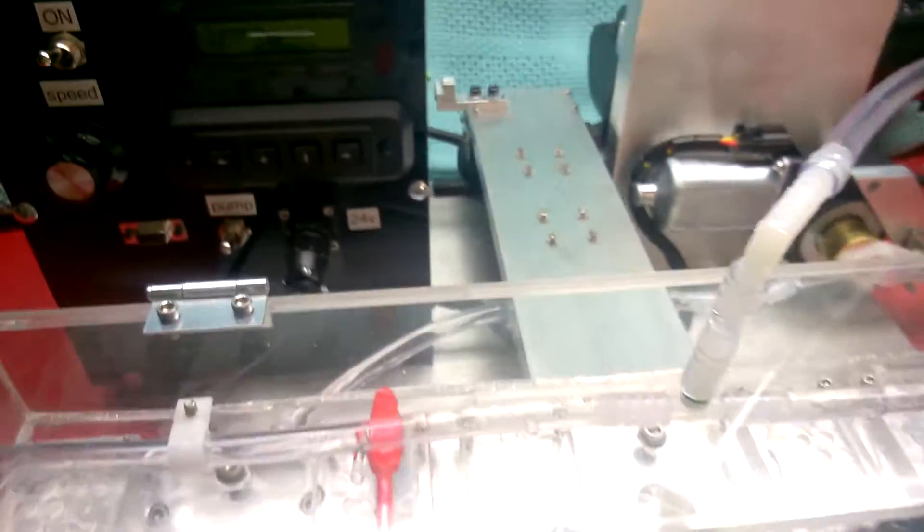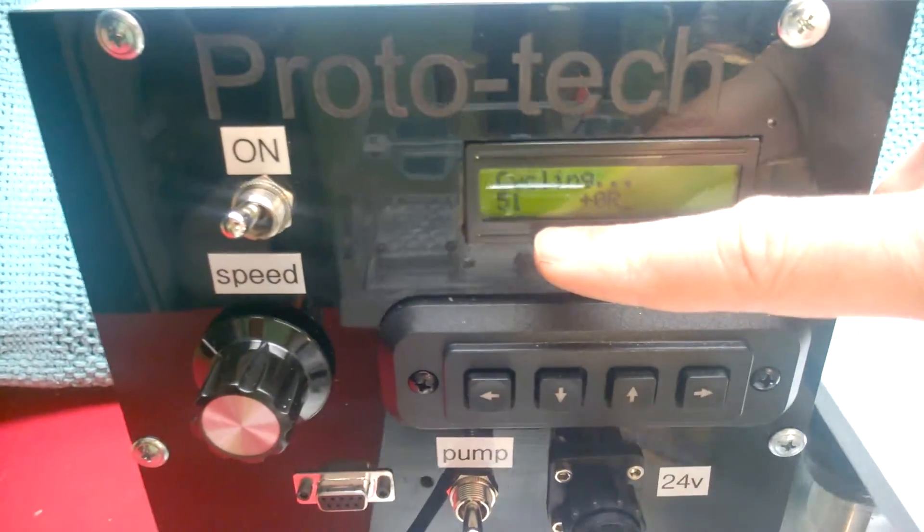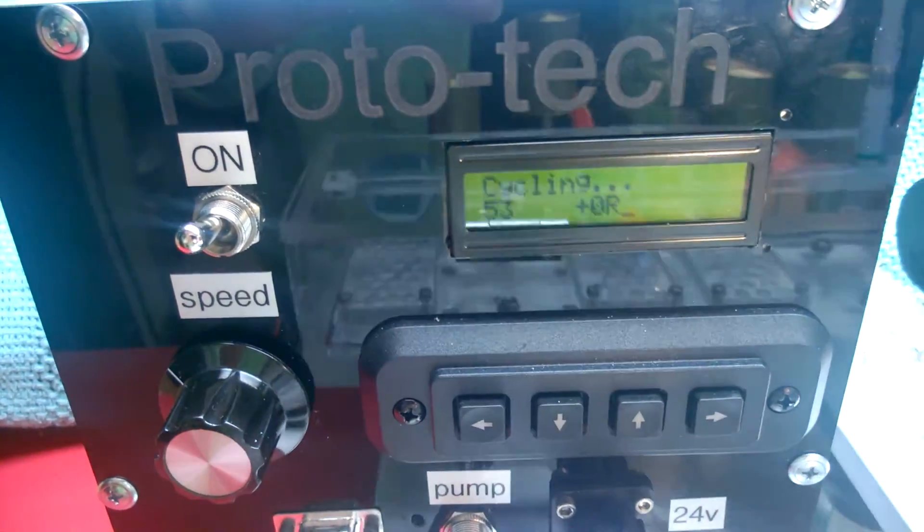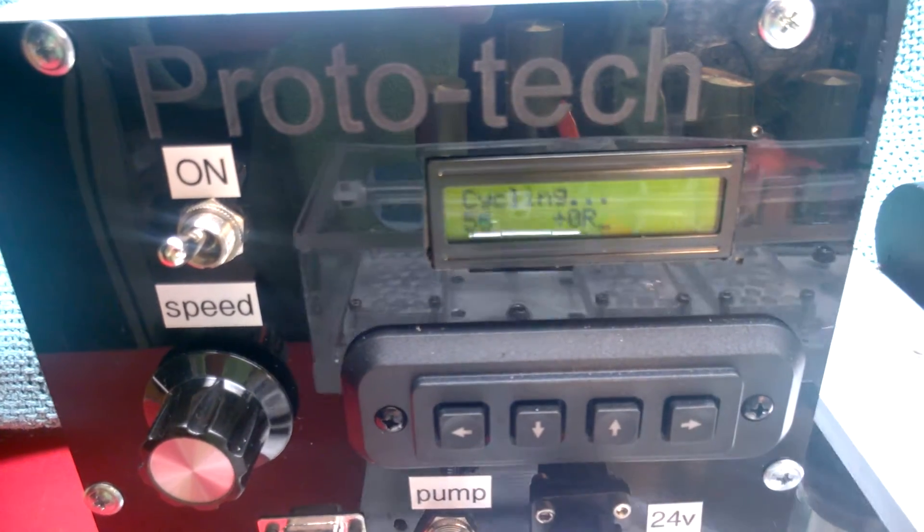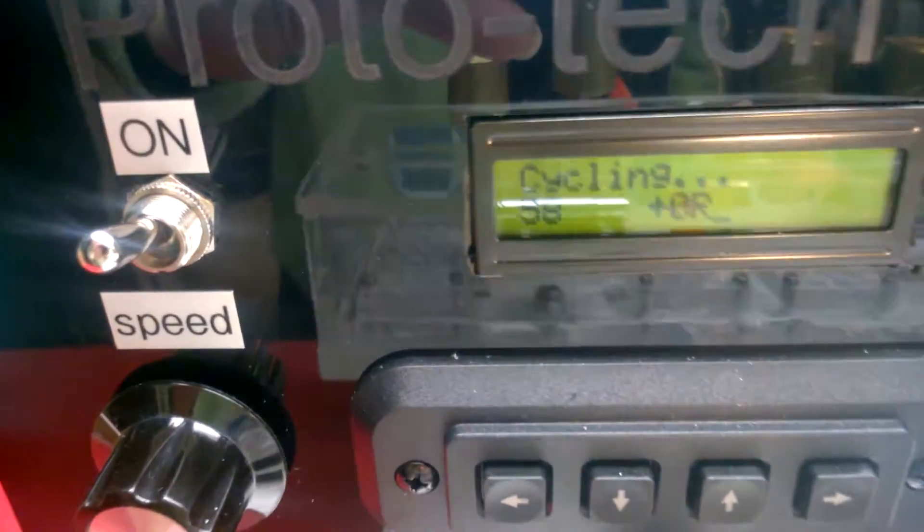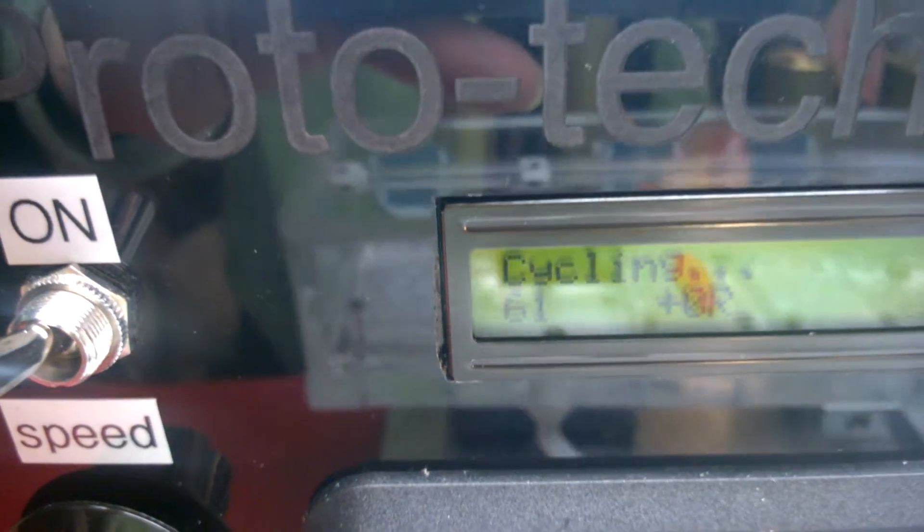And we're back in business. You can see the number of cycles being elapsed on the counter, up to 54. And cycling will resume and continue until the maximum is reached.